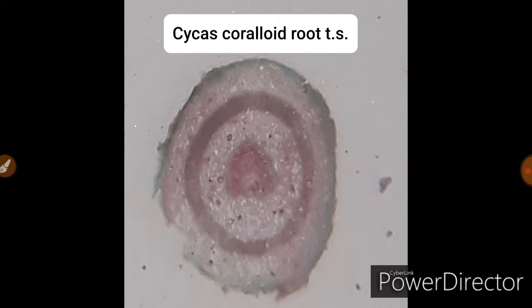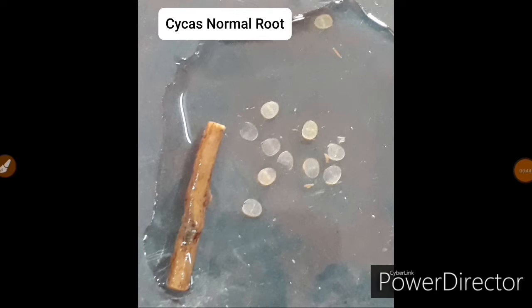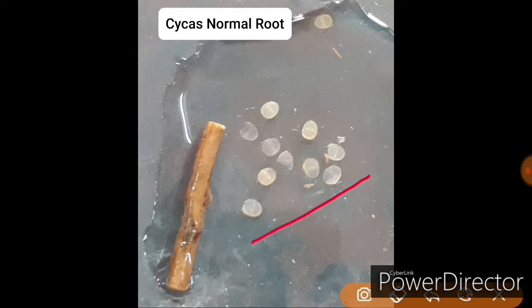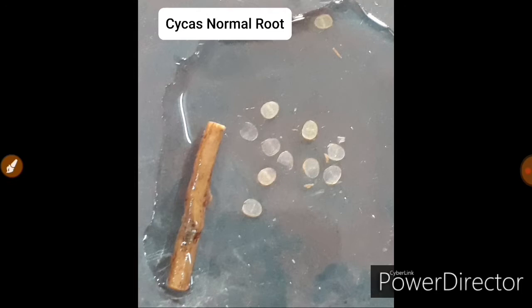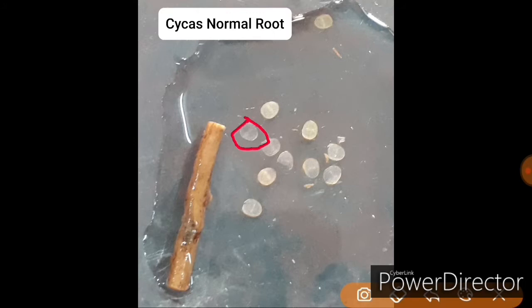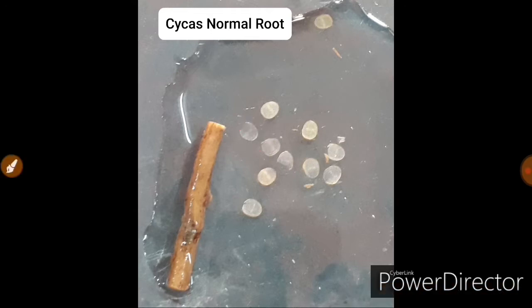These are portions of a normal root of Cycas — lots of transverse sections placed in a petri dish. What we do during section cutting is cut lots of sections of the material and then select the thinner sections for slide preparation. As you can see in this image, this is the thinner section that we select and place for further processing for permanent slide preparation.